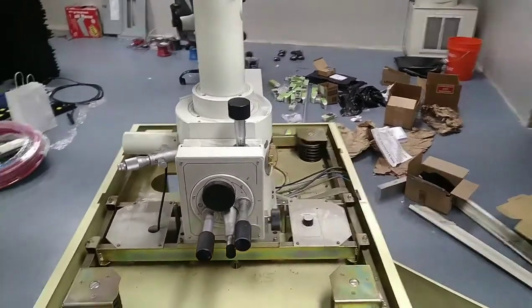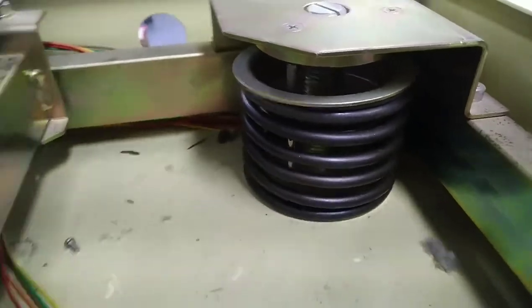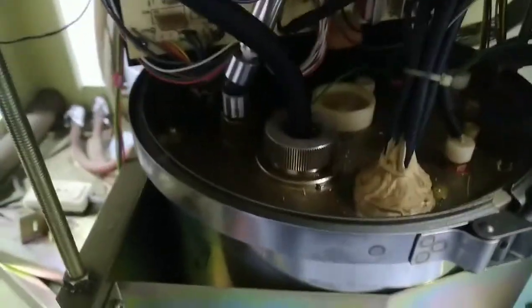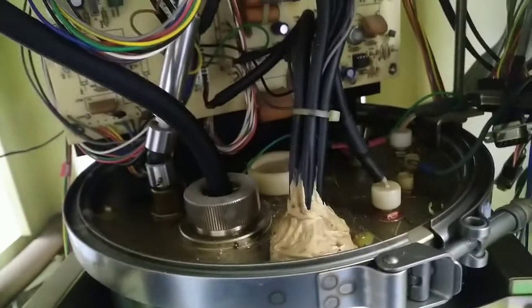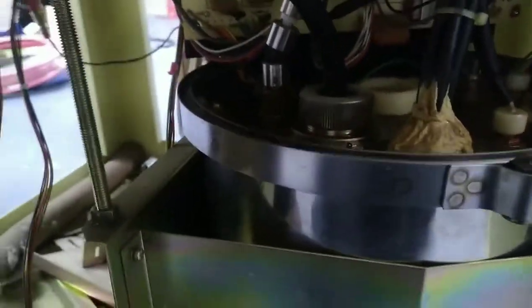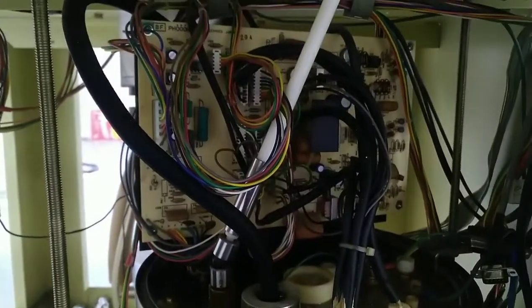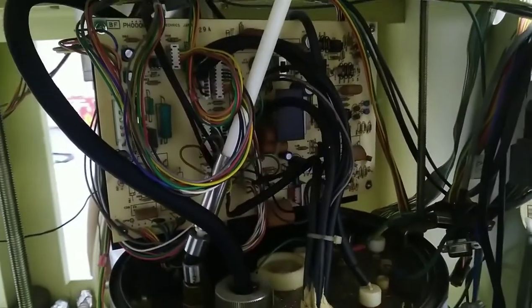All the screws were very stripped, but you can see it's just isolated on these big springs here. Down here, I'm sure this part is the high voltage power supply. The gun bias knob on top has a mechanical linkage into it. I don't think it's under vacuum — I think it's just under oil. That's unexpected. I'll have to see whether I can salvage this and get it to operate, or just figure out part of it, or replace it entirely.